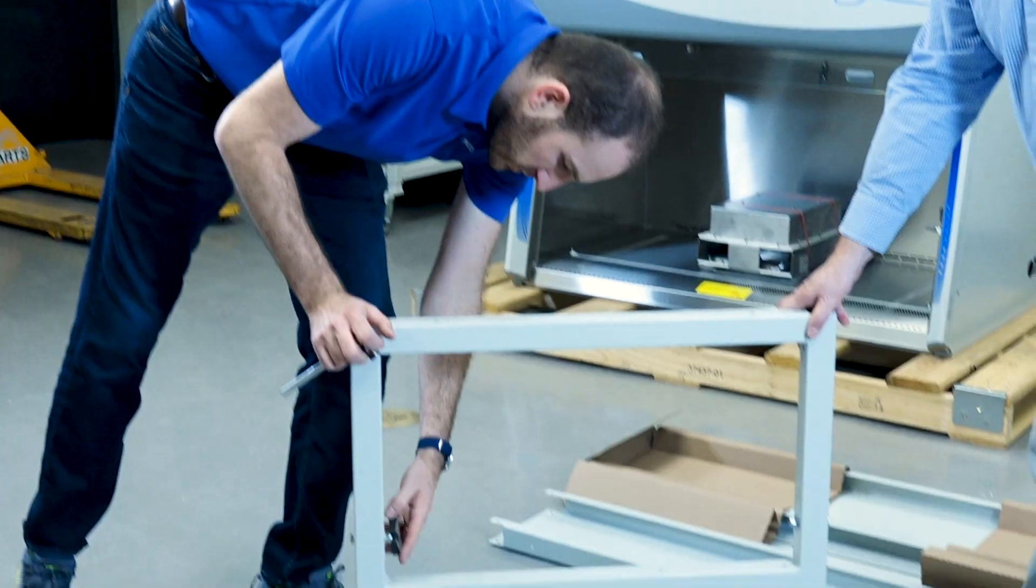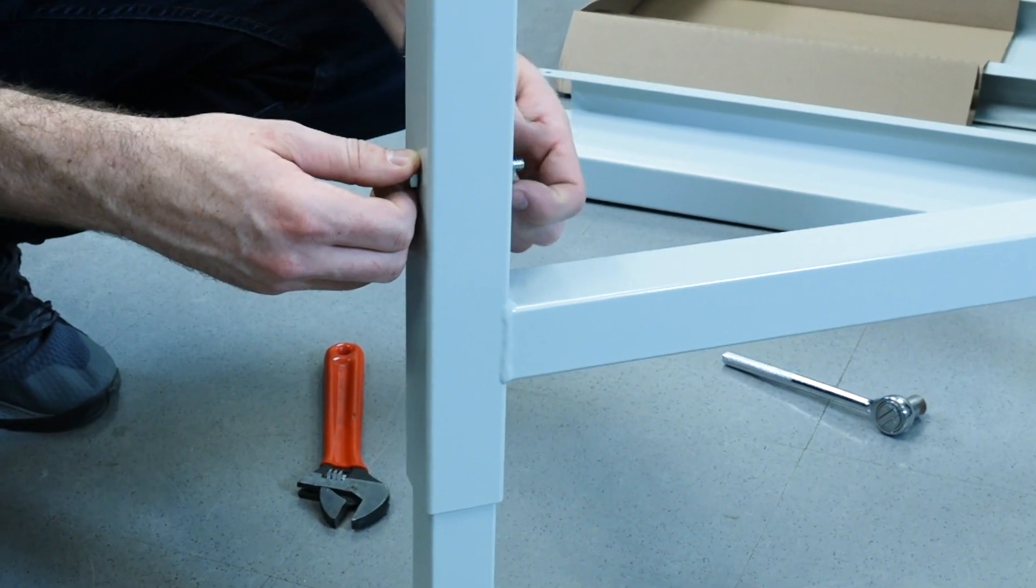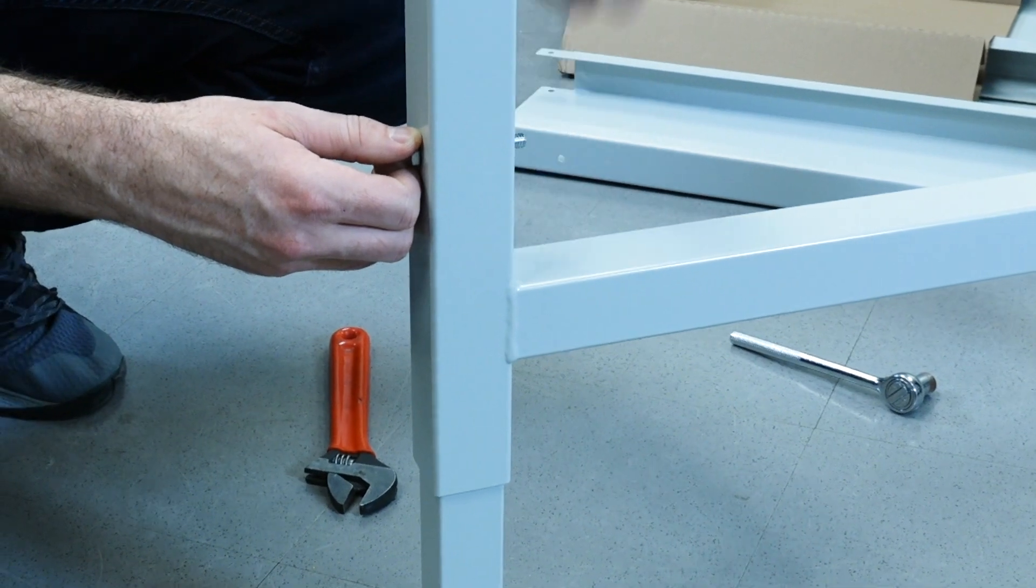To adjust the base stand, loosen and remove the leg bolts. Once placed in the desired position, tighten the bolts.